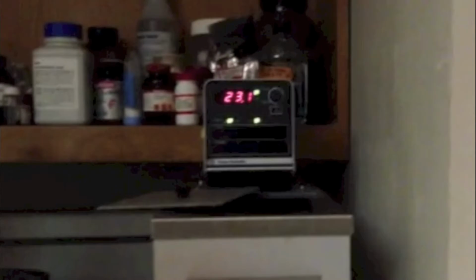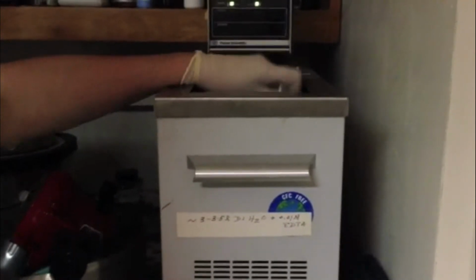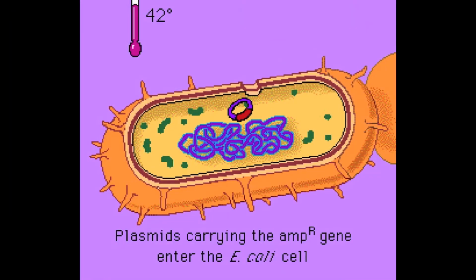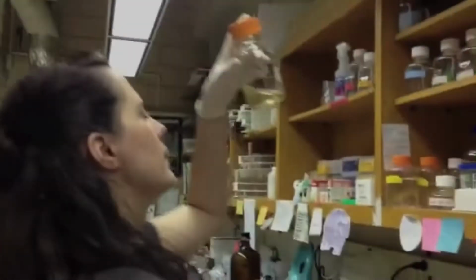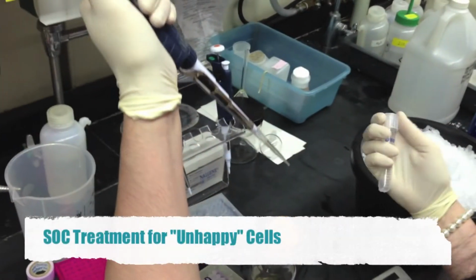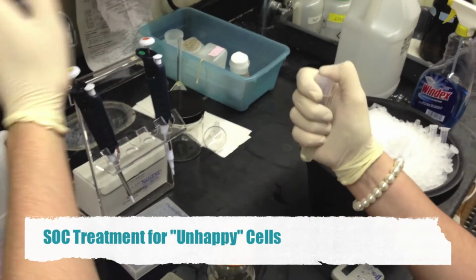Some scientists believe the brief heat shock creates a thermal imbalance between the inside of the cell and its external environment, which therefore helps to pump the DNA into the cell. After this brief heat shock, the cells will be somewhat unhappy. In order to ensure that colonies will grow, you must add some SOC to the tubes and agitate and incubate them. SOC is a nutrient broth that will be eaten by the cells and help them regain their structure and strength after the heat shock.